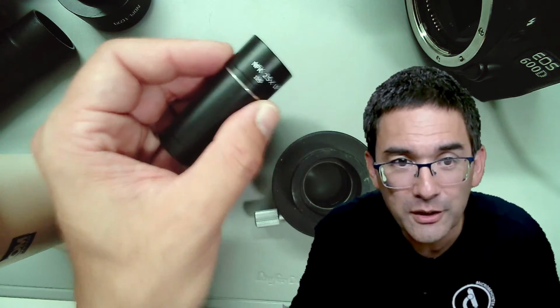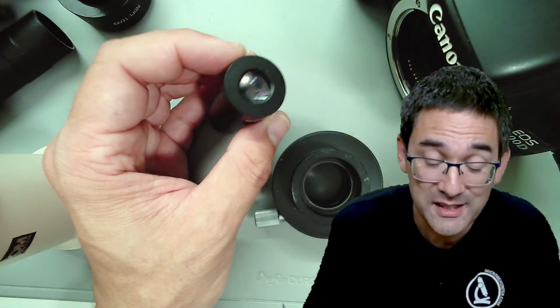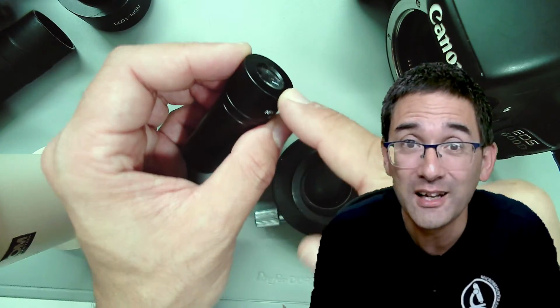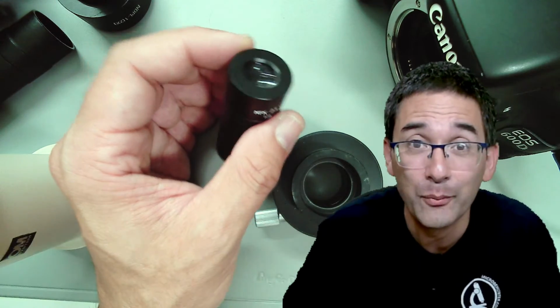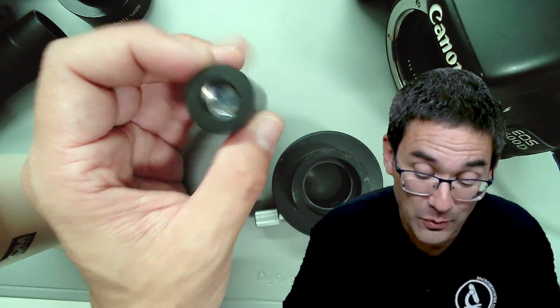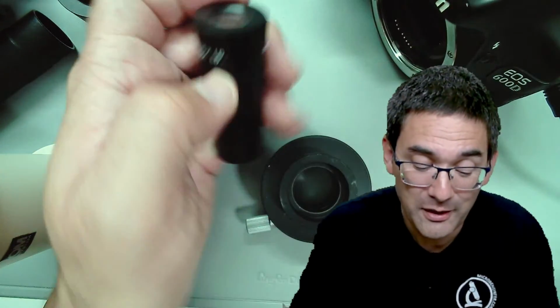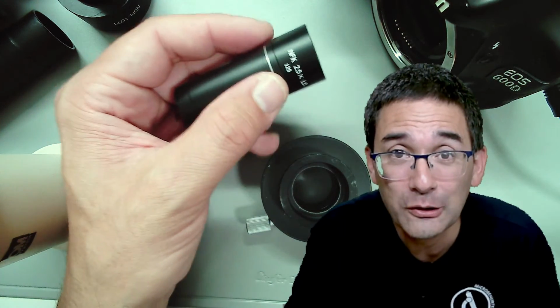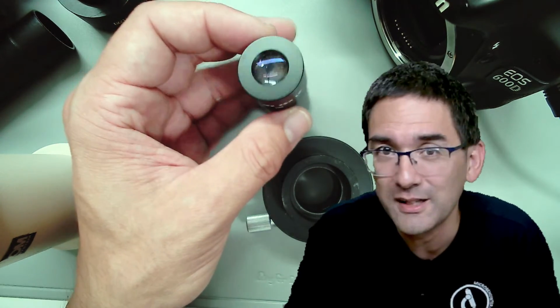Now, there were different oculars available for different camera and sensor sizes, and this one over here is actually designed for full format, for the film size, because this was manufactured at the time when we still used analog film. Then when the cameras came out with a smaller sensor, there were also oculars for the smaller APS sensors, and they immediately sold out, to astronomical prices.